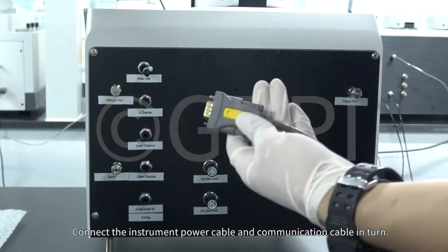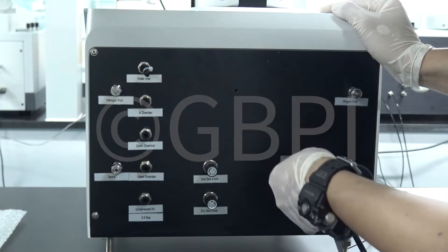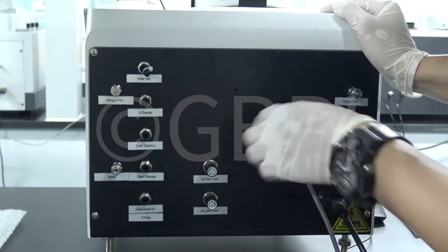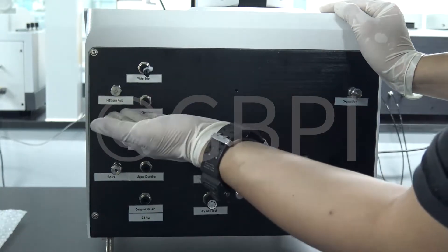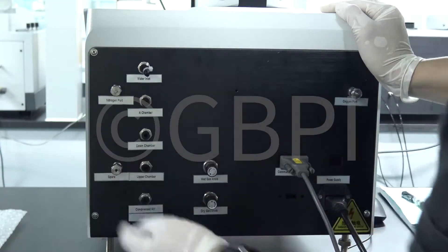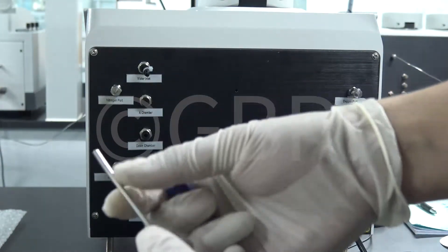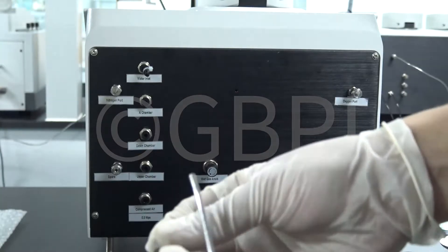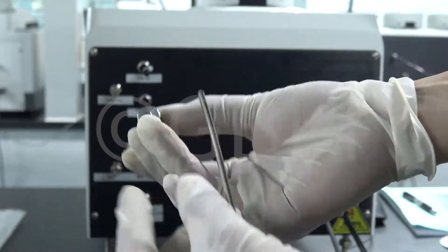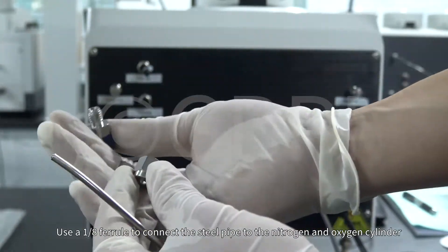Connect the instrument power cable and communication cable in turn. Use a 1/8th ferrule to connect the steel pipe to the nitrogen and oxygen cylinder.